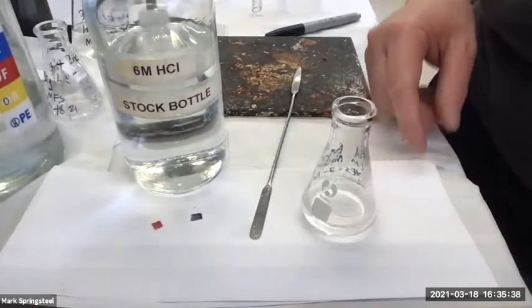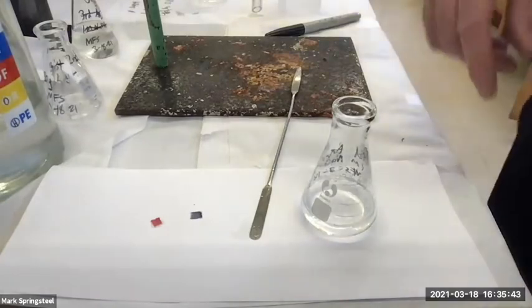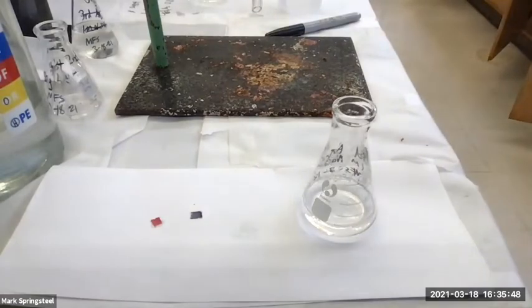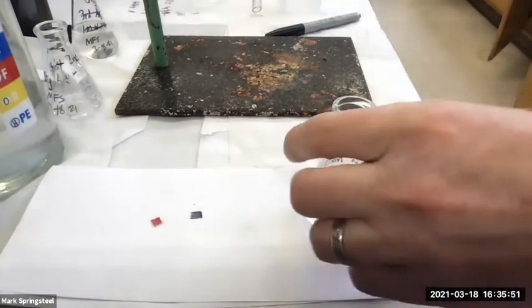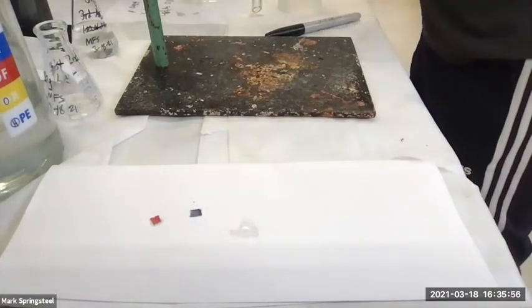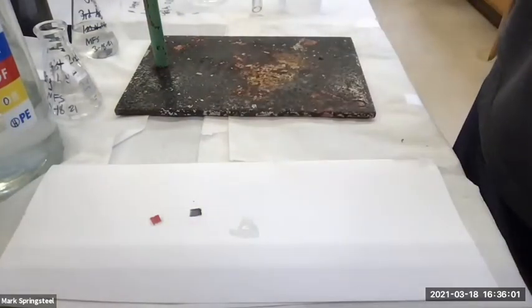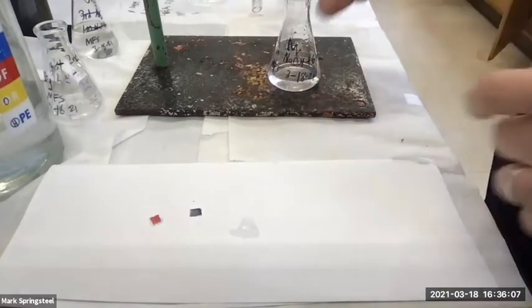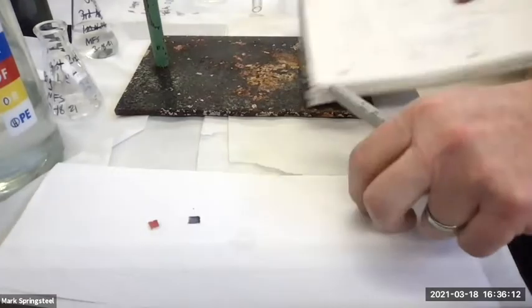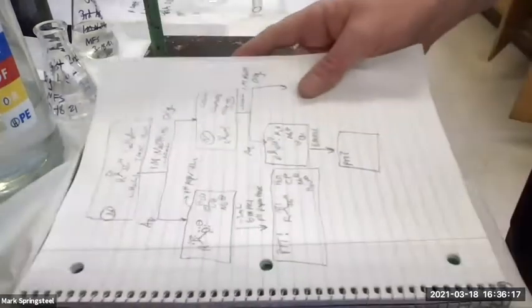That's good news, right? A lot of times when you don't get a precipitate, it seems like nothing happened, so it's not good news, but this is definitely good news. So let's look at our extraction diagram and figure out why this is. Make sure we understand what's going on. So that's my third aqueous. Oh yeah, and this sodium hydroxide was made acidic with 6 molar HCl. I keep good track of what's going on. Not only will I not get confused, but at the end of the experiment, when I want to clean up, I'll be able to clean up properly. So I'll know, oh, that's an acidic solution. I should handle it as an acidic solution.